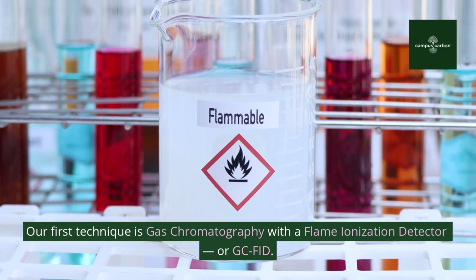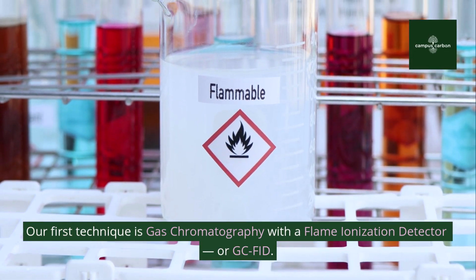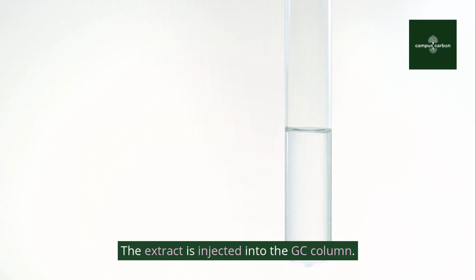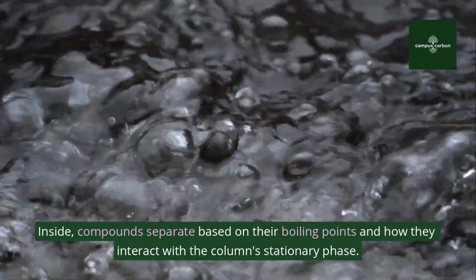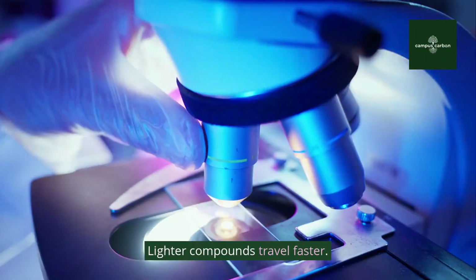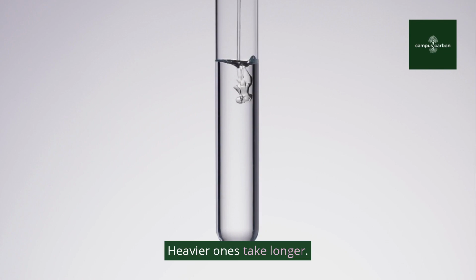Our first technique is gas chromatography with a flame ionization detector, or GC-FID. The extract is injected into the GC column. Inside, compounds separate based on their boiling points and how they interact with the column's stationary phase. Lighter compounds travel faster. Heavier ones take longer.